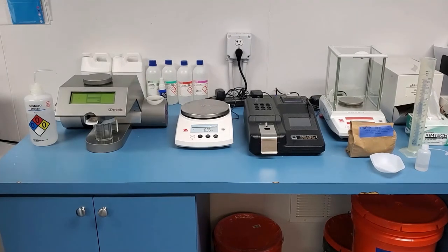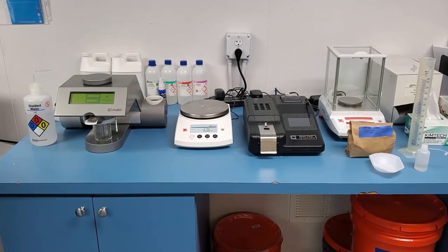After your machine has started, it will heat to 35 degrees Celsius before the countdown starts. After it has reached its temperature, it will walk through all six steps of measuring the starch damage throughout the flour.